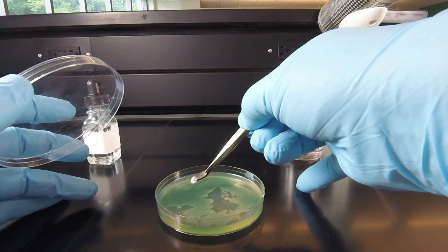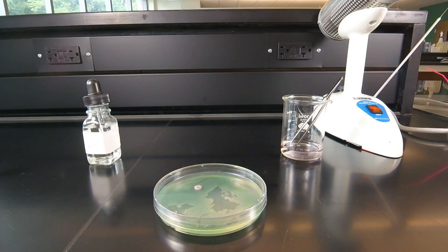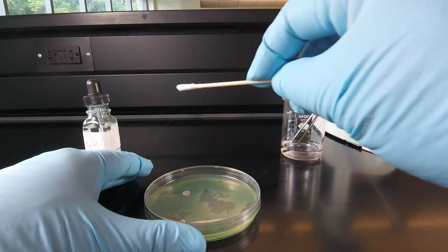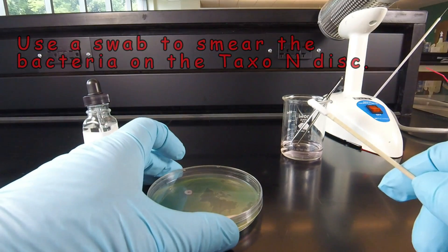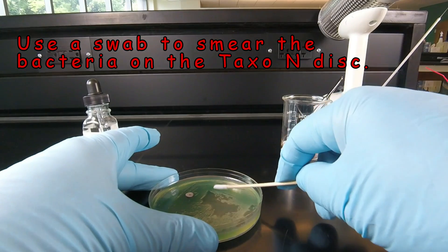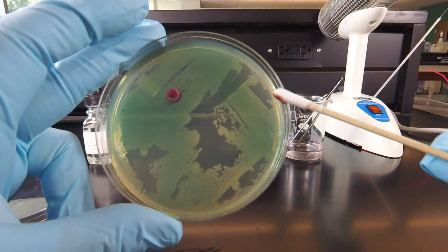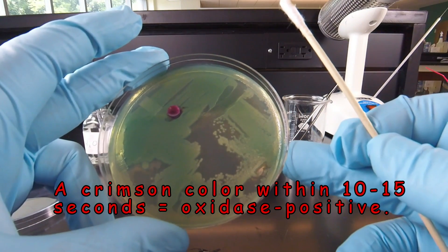We place the activated disc on our plate of the bacterium we're testing. Then we take a sterile swab, scrape off some bacteria, and smear that onto the disc by dabbing it. We're looking for a pretty much immediate crimson color within about 10 seconds. You can see that it's starting to turn an immediate crimson color — we see it both on the swab and on the disc. That is a positive immediate oxidase test.